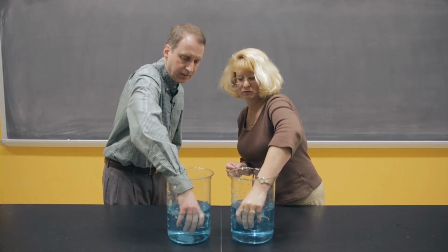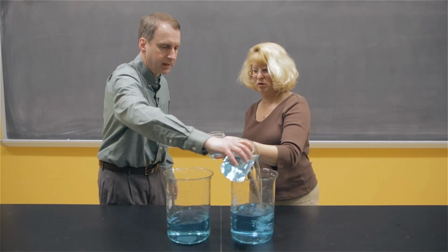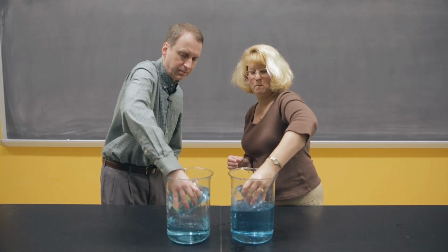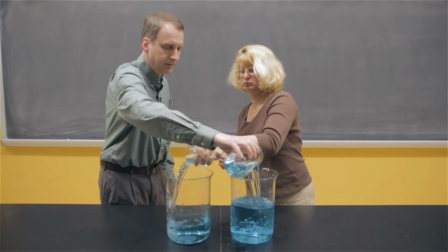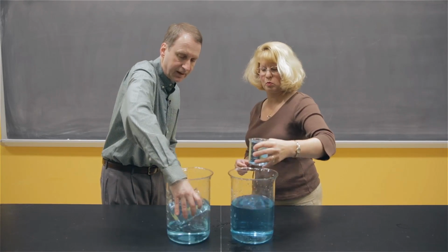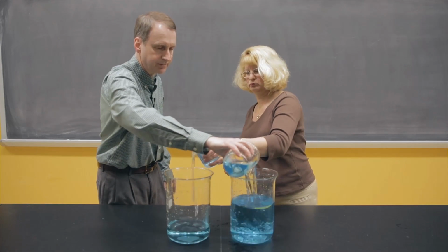And of course in the first dip we can both fill up our beakers entirely and we'll transfer over to the other side. The next dip, same thing. Mine's basically full up, yours is full up, and we'll keep going. Now notice the levels in the large beakers are changing. Mine's going down, and in fact now I can't get a full 600 milliliters to transfer.